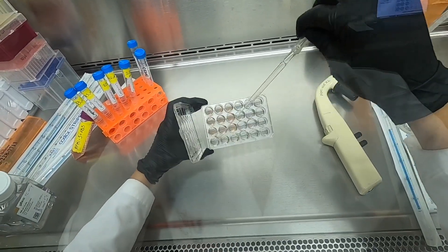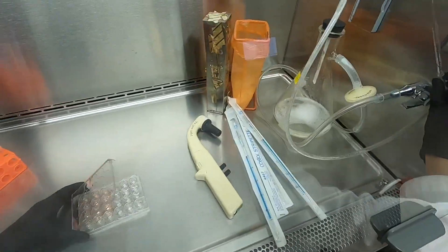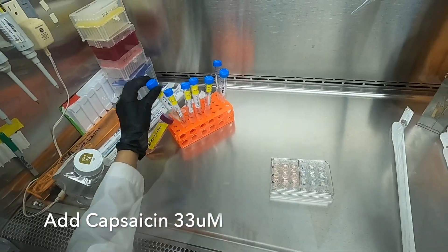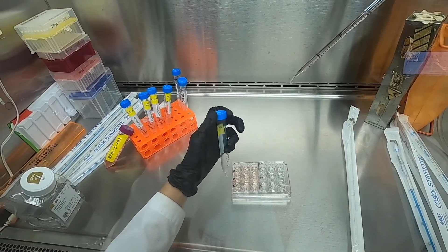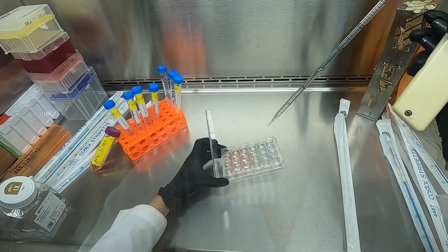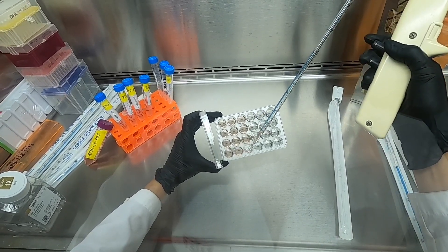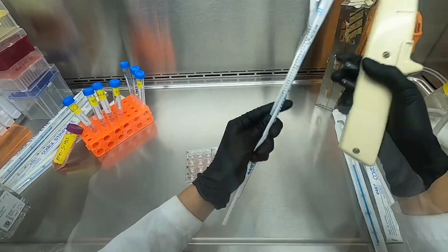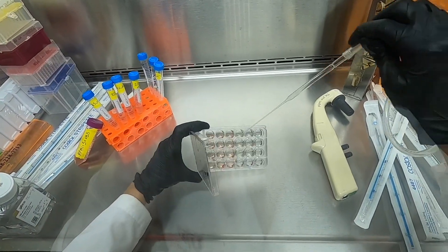For the next few steps, we will be removing the PBS from individual groups of treatments and replacing it with a specific concentration of capsaicin. As opposed to our previous two experiments, we will only be using 5 concentrations of capsaicin — the 5 middle concentrations we previously used. The highest concentration will be 33 micromolar and the lowest will be 2 micromolar.